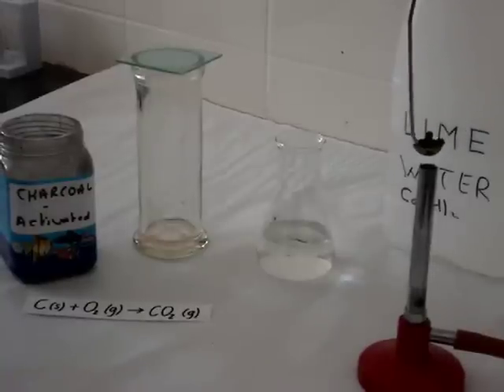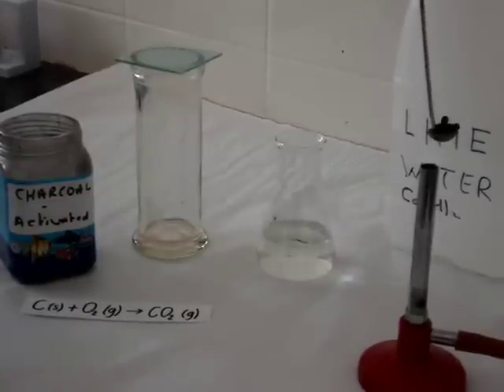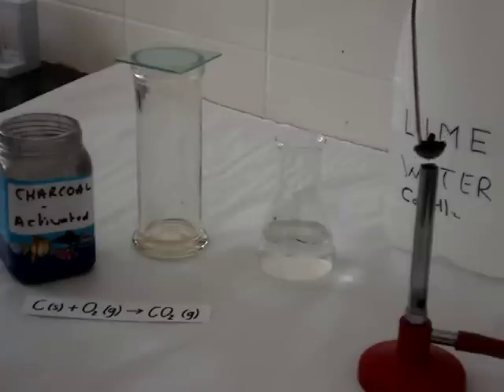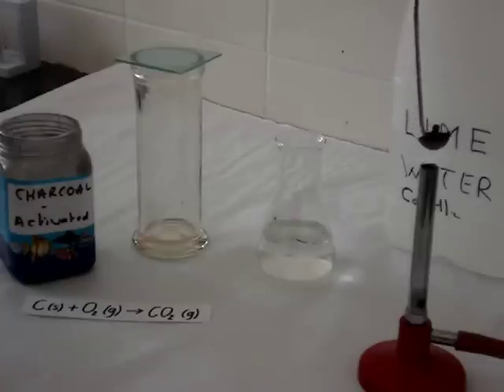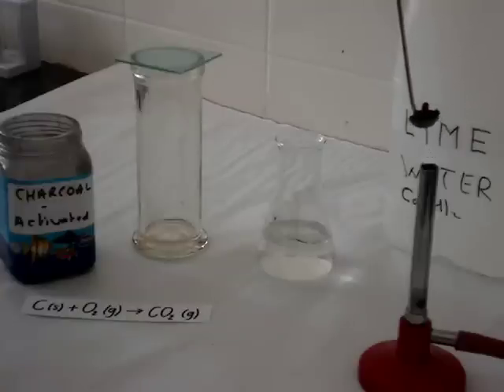It won't really ignite very spectacularly because it isn't very reactive, but it glows with a reddish colour. We'll plunge it into the oxygen in the gas jar, and carbon reacts with oxygen to form carbon dioxide gas.